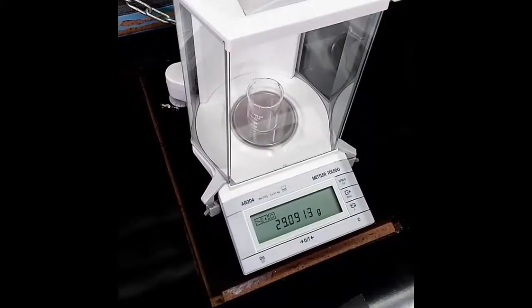Make sure that the receiving vessel is completely dry, otherwise the Weighing by Difference method should be used.